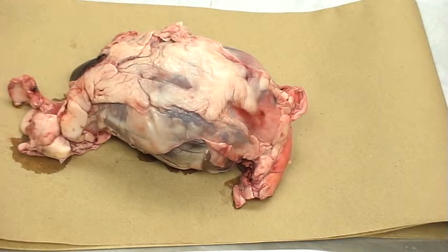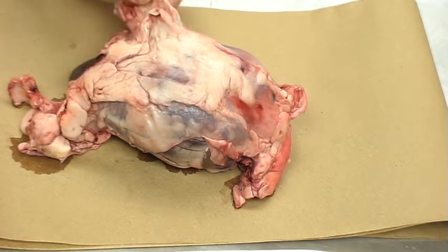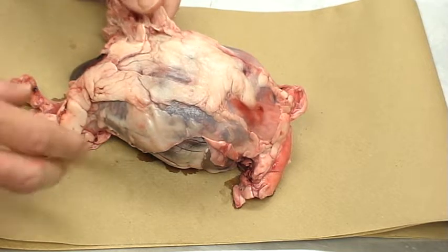the pericardial sac. Now this seems really gross and disturbing to people, but in fact we use the deer heart because it's so similar to what the human has itself. It's not unusual, in fact it's very normal, to have a lot of fat in the pericardial sac.